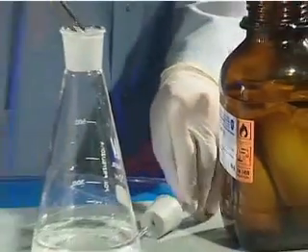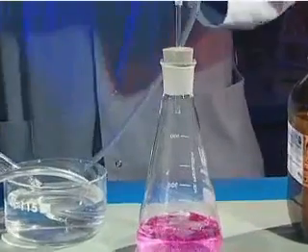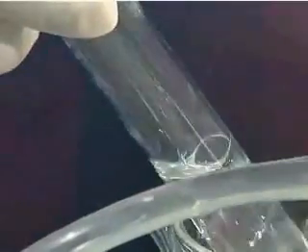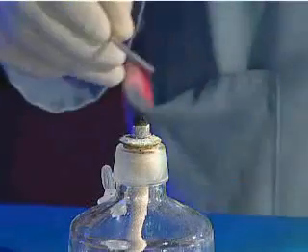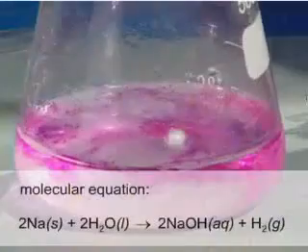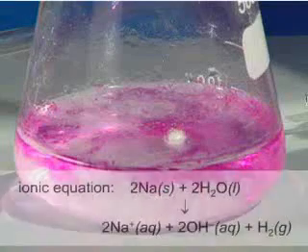Sodium reacts violently with water at room temperature. During the reaction, a large amount of energy is released. Note that a piece of sodium added to water floats on its surface because it has lower density. The considerable amount of energy released by the reaction melts the metal. The reaction produces sodium hydroxide and hydrogen gas. The process can be written as follows, and using ionic notation.